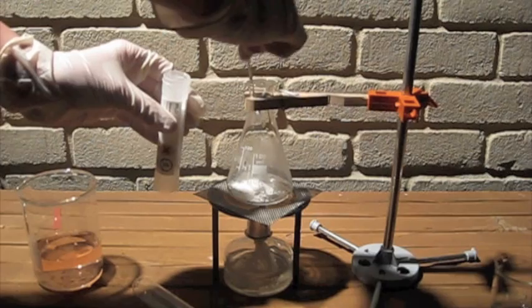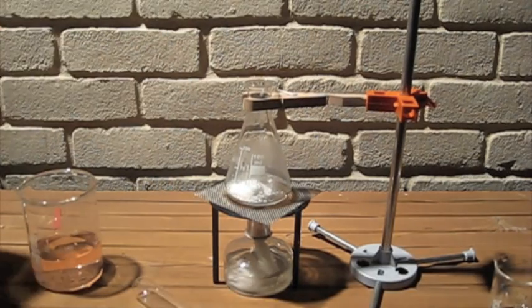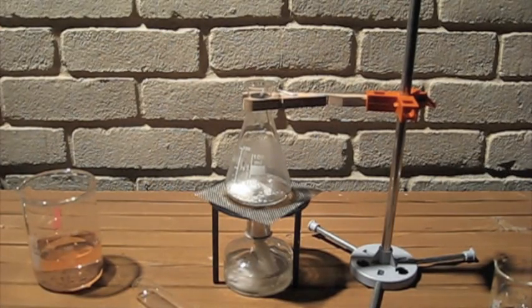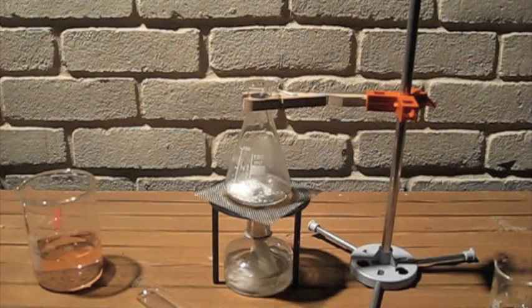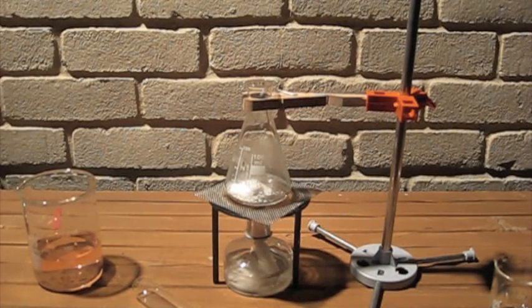You can use sodium hydroxide instead of calcium hydroxide. In fact, it probably will produce more ammonia since it's a stronger base. But right now all I have is calcium hydroxide.